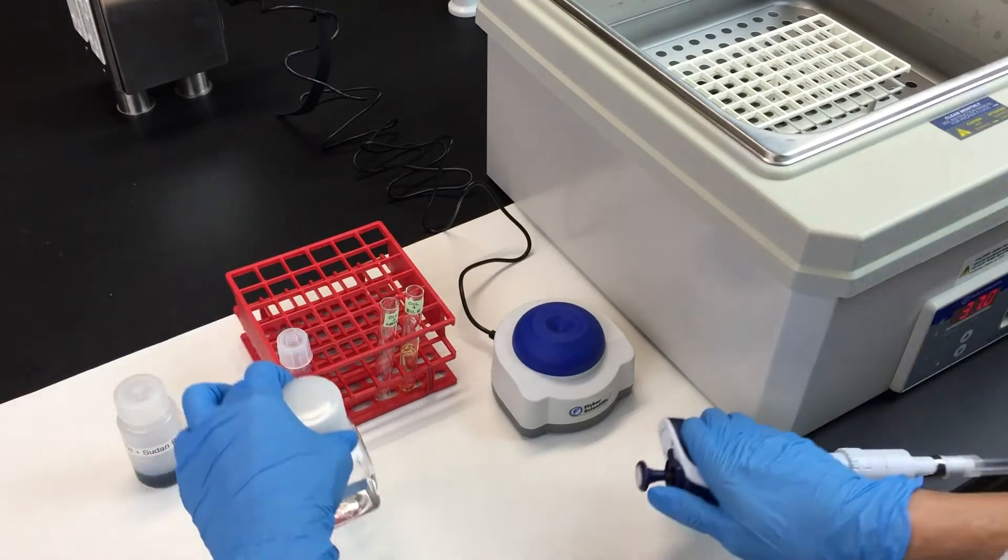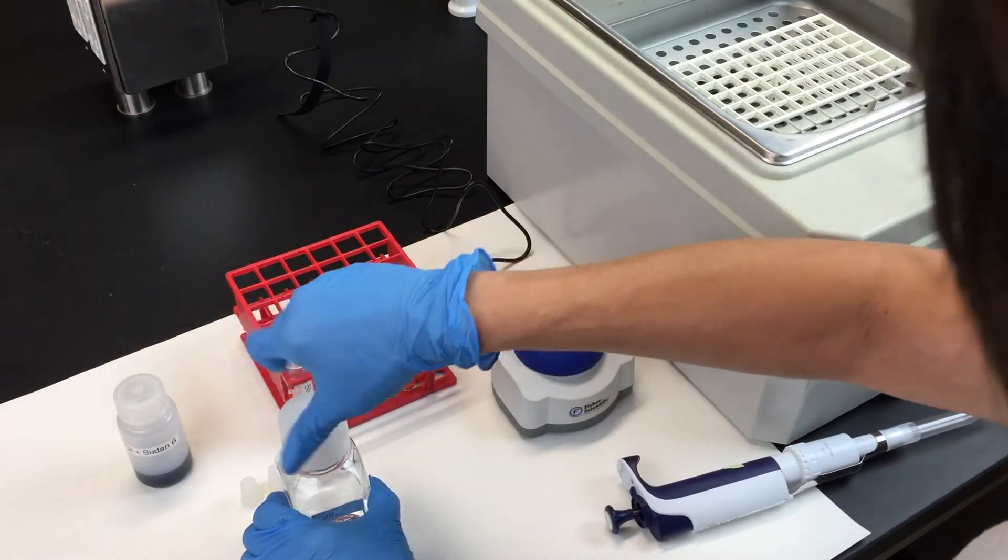Now add four milliliters of water to the oil and water test tube.